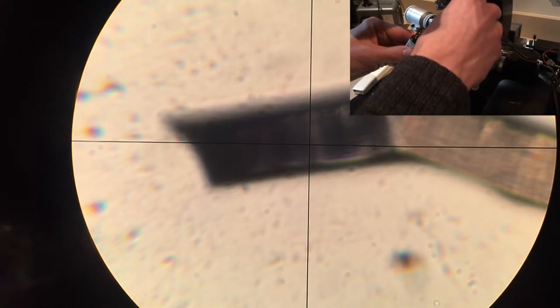It passes a current through the heating wire, which is nichrome, and the electrical resistance of it generates heat. So we can control that with a power supply and then use your multimeter to figure out what the temperature is with the other thermocouple. I'm just adding some oil here, refractive index liquid to it.